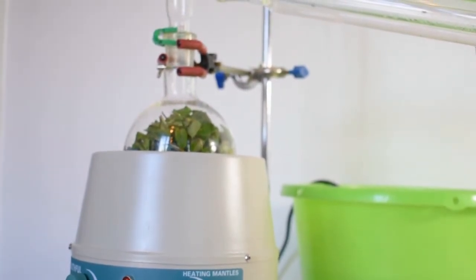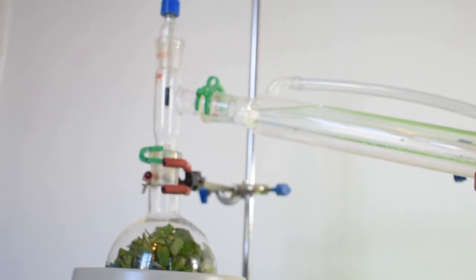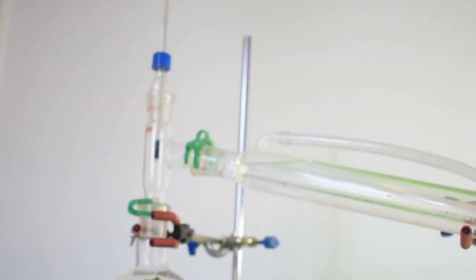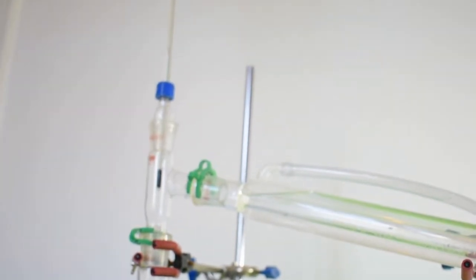The vapors of mint oil and water will rise up into this still head, and there is a thermometer in the still head to measure the temperature of the vapor. It should be about 100 degrees throughout the whole distillation.